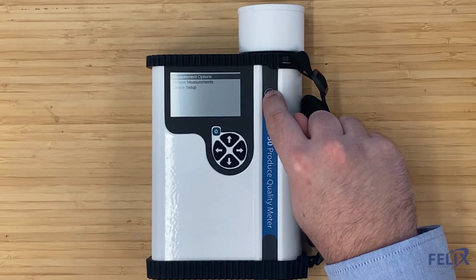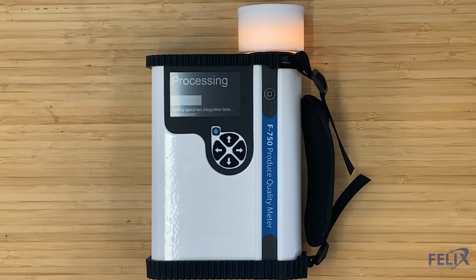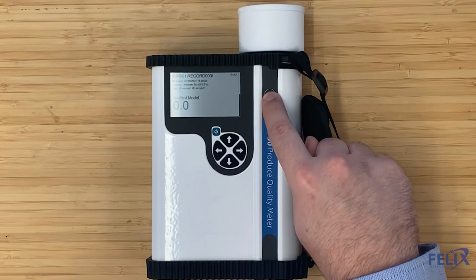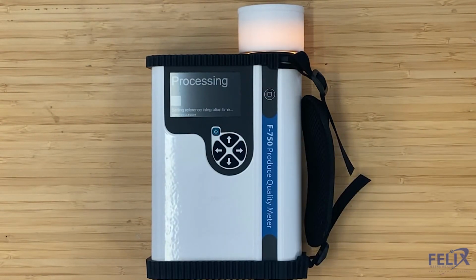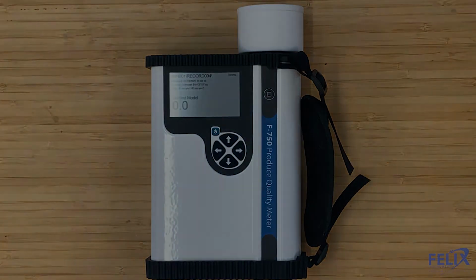So we're going to click the measurement button and scan our object of interest. For this demonstration purpose, these are simply polypropylene blocks. And so now the instrument is just going to be collecting all that spectral information, which we can then go and use to create chemometric models inside of the AppBuilder software. So we'll go ahead and take a couple scans here. And you saw on that screen that the result displayed as 0.0, and that's simply because we don't have any sort of model built into this application yet. It's simply there to help the instrument collect data for the model to then be built.